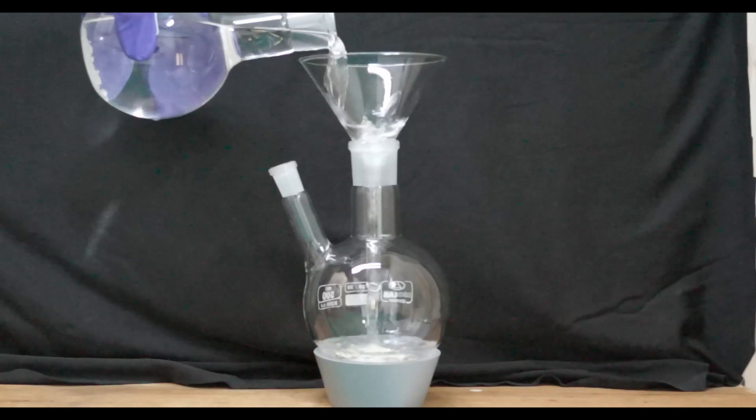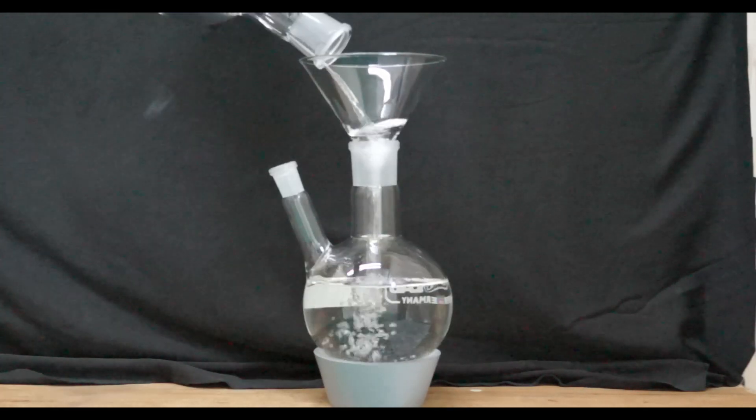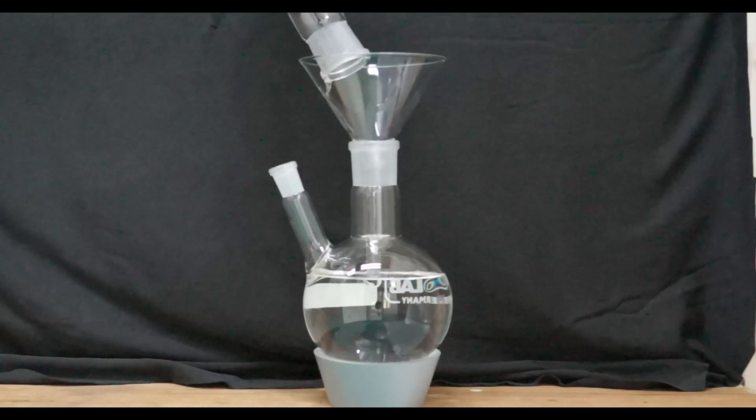The next morning I decanted the product which should be fairly dry now into a 500 milliliter two-necked flask. Next I assemble glassware for simple distillation.